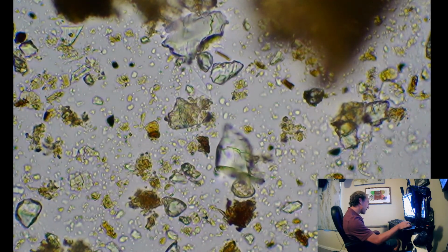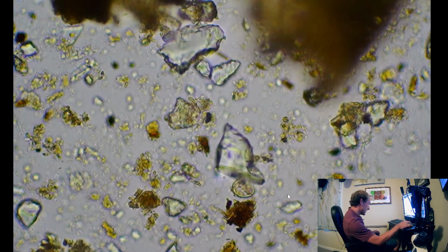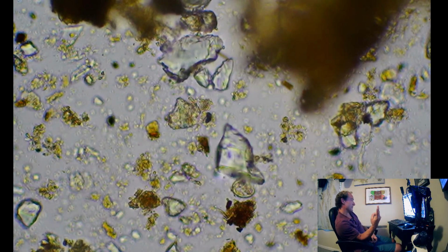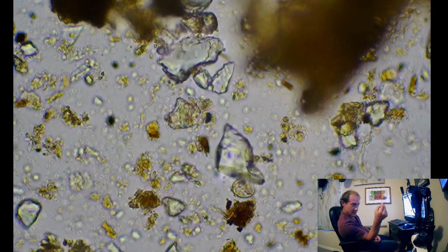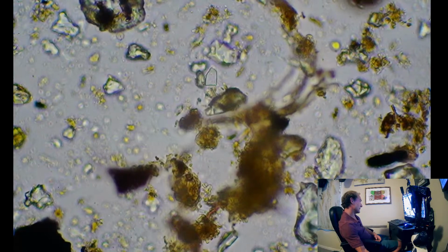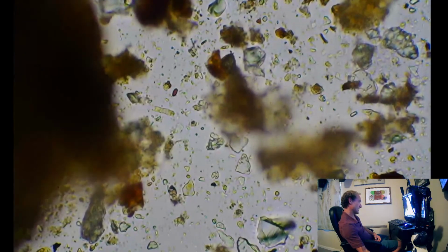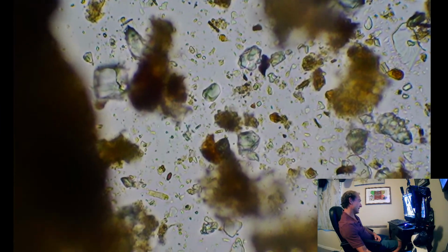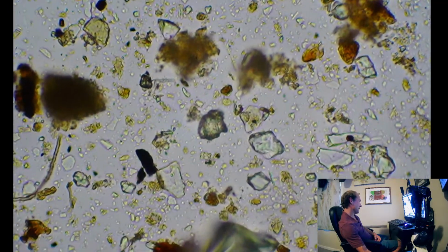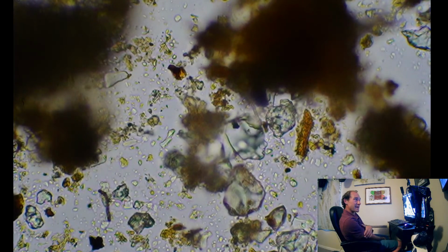That might be another amoeba there. Yeah, I think I see a cell wall. So yeah, that's another thing. I think we only saw two amoebas on this whole slide. That's a rarity. I'm starting to think amoebas are one of the best things you can see. It's just a sign of good soil. It's just a good sign, in my opinion, in my experience so far.